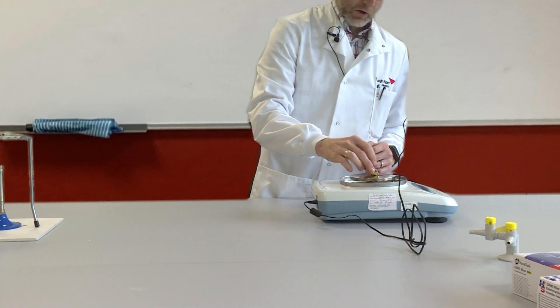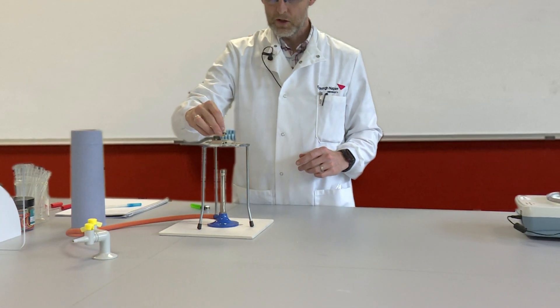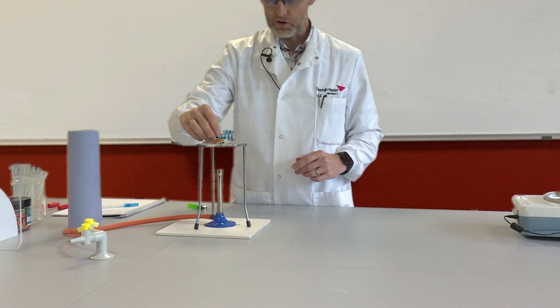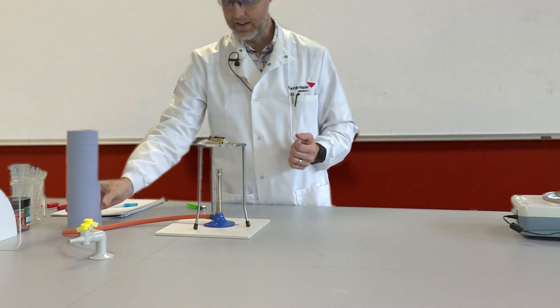So now we're going to heat this. This is acting as a little crucible. We're going to heat this with a Bunsen flame, full open air hole, blue flame, for approximately 5 minutes.